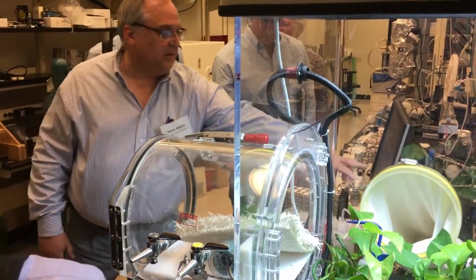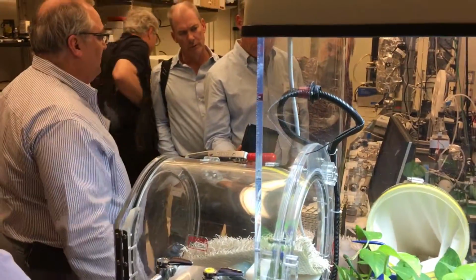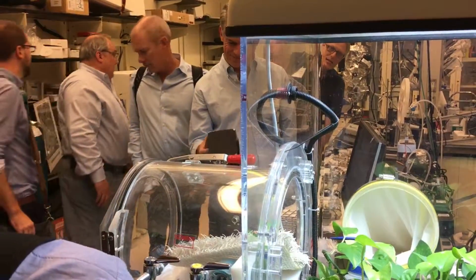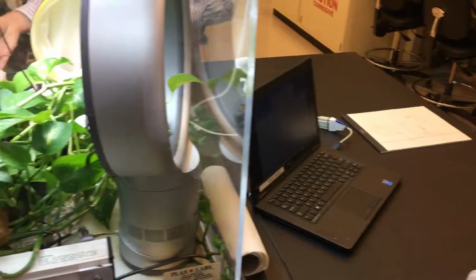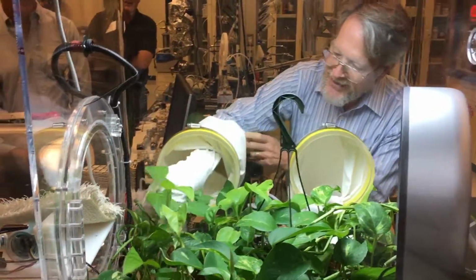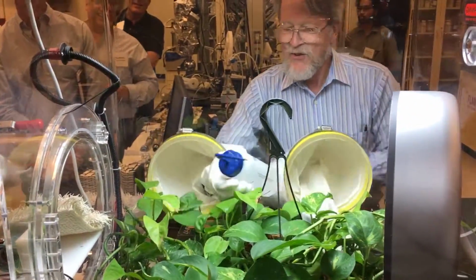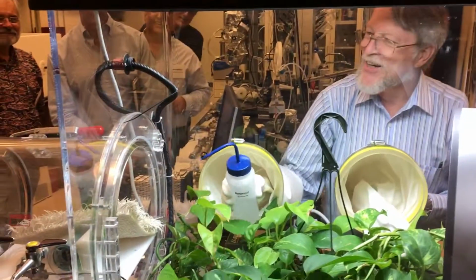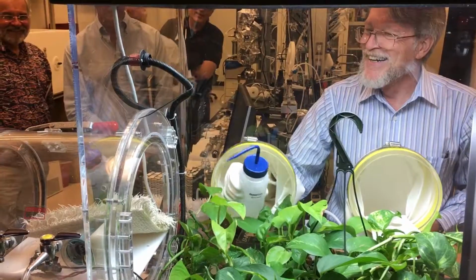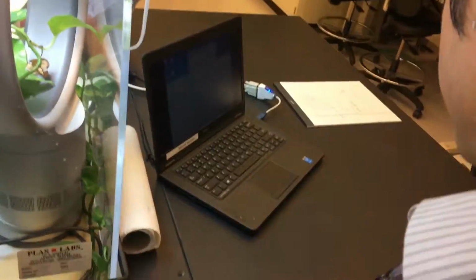And you can see here that this is in fact doing what it's supposed to do. Is the CO2 going up there? Yes. So this shows water. Water goes slightly down. We didn't need to cheat. This isn't cheating. Cheating is opening the door and breathing in there. We don't like to do that because then you see how little CO2 it is.